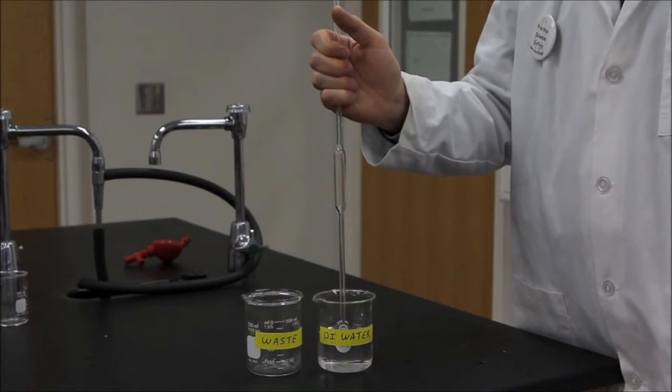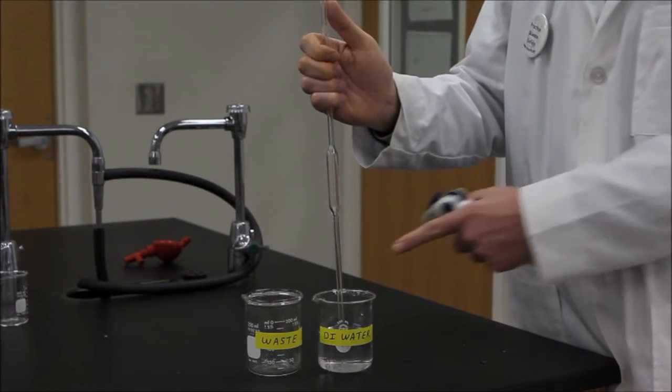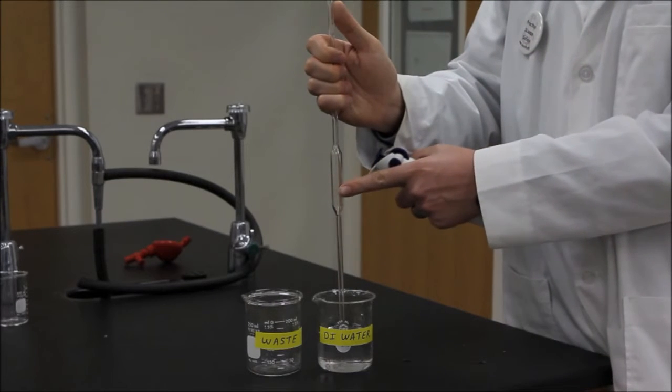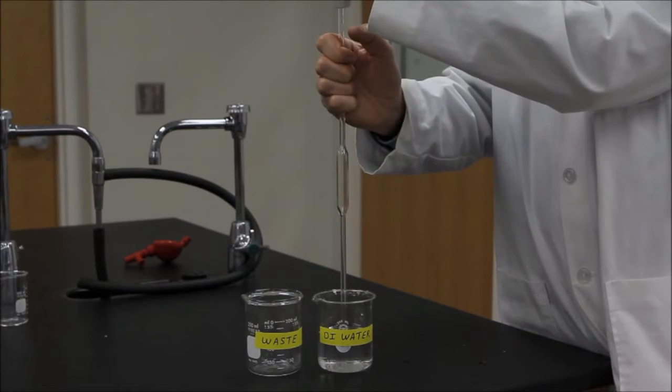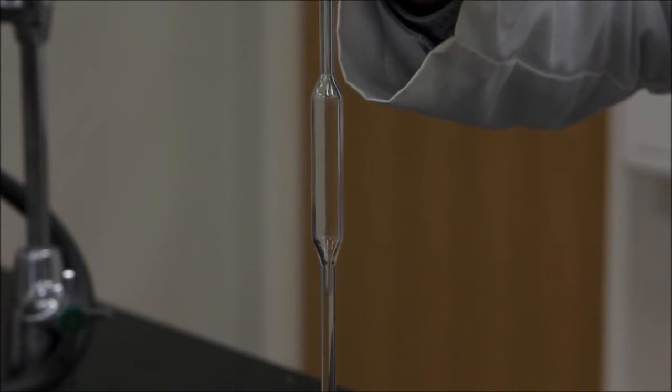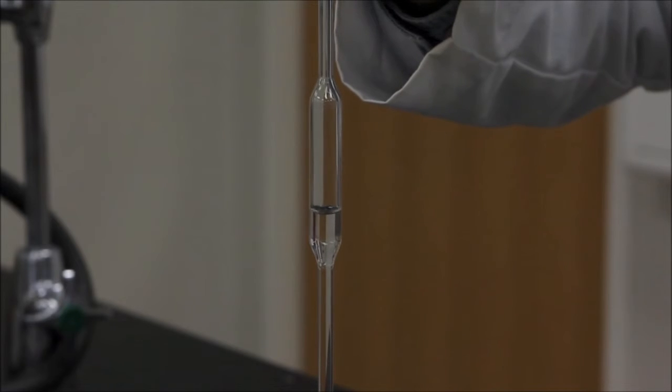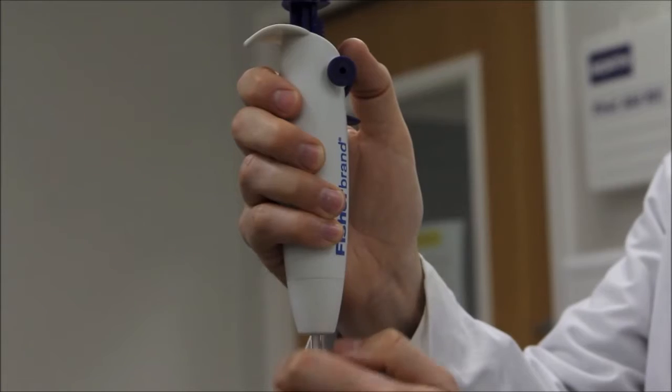It is always good practice to first clean and then rinse your pipette. To clean, insert the tip into a small container of deionized water, and using a suction device—never your mouth—draw up enough deionized water to approximately half fill the pipette.